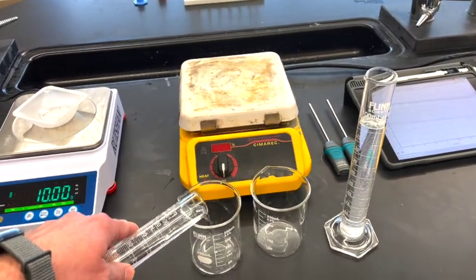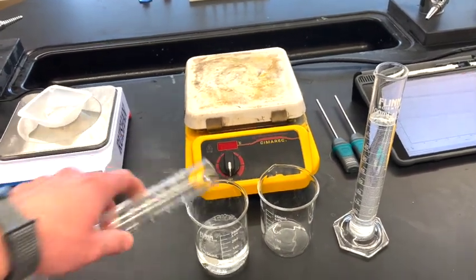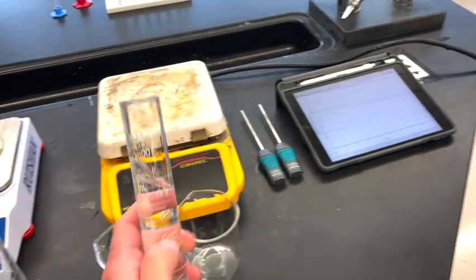Hey everybody, I'm going to show you a couple of demonstrations today using colligative properties. This first one is boiling point elevation.